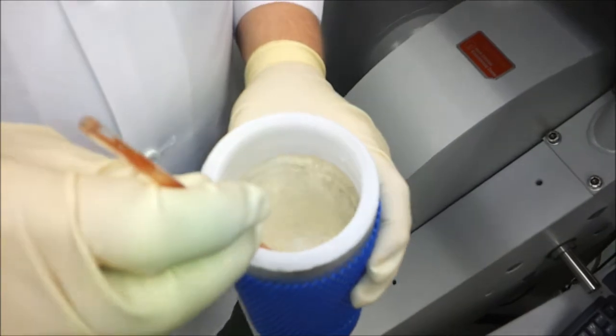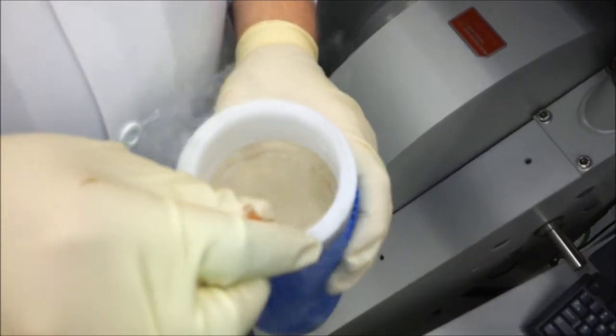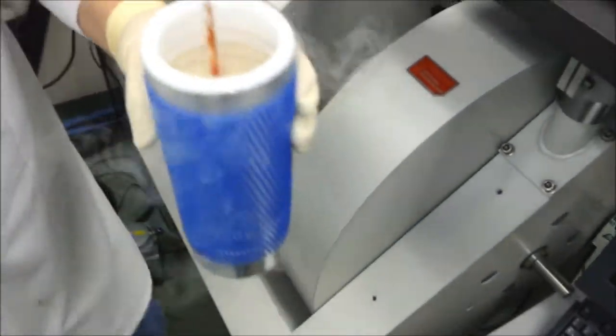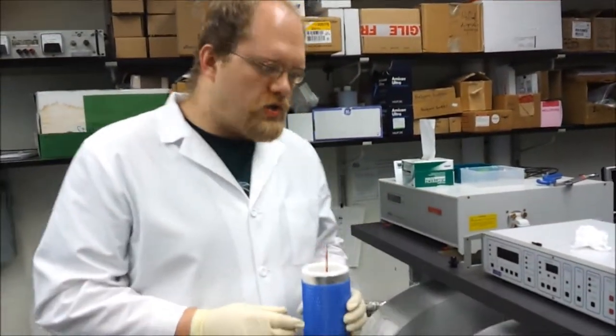And then once the solution has been frozen, you can then put it in the rest of the way. Alright, so that's how you freeze the EPR tube.